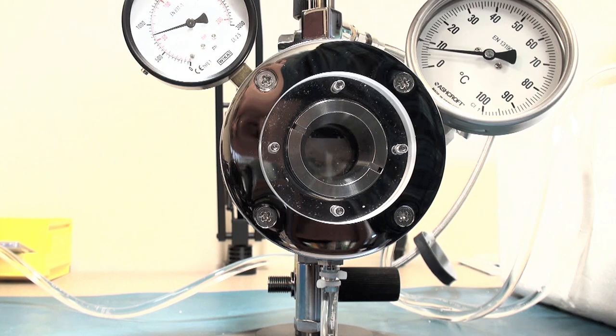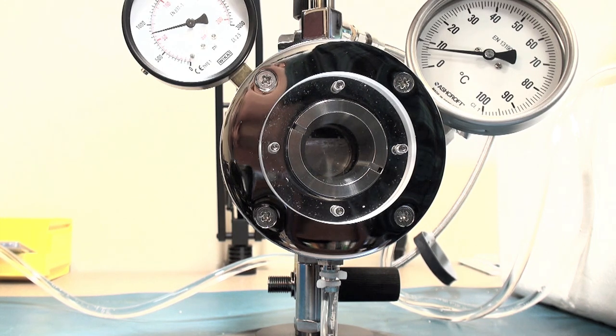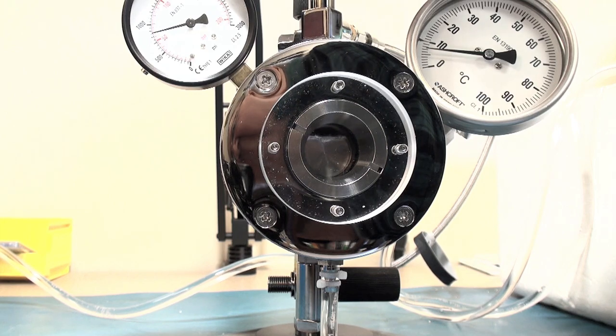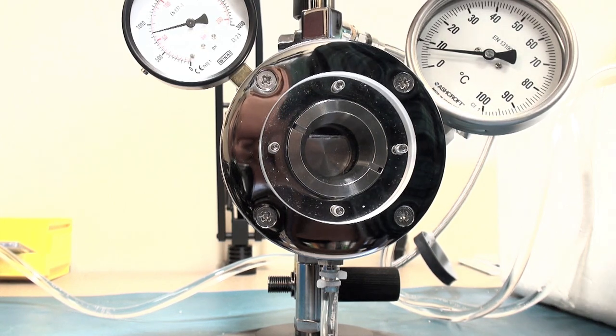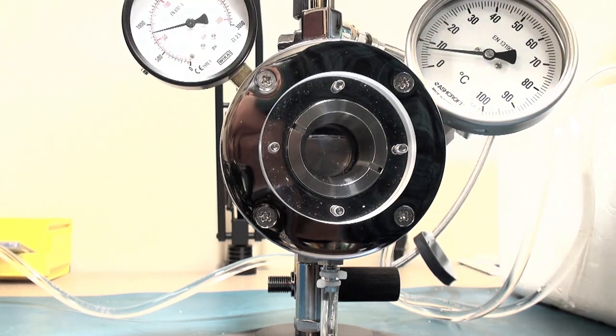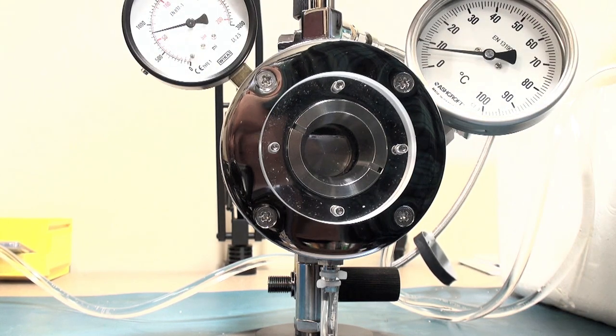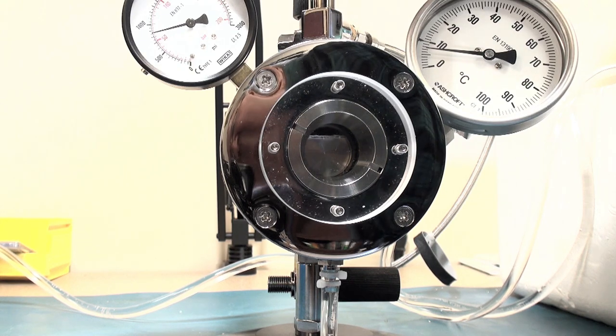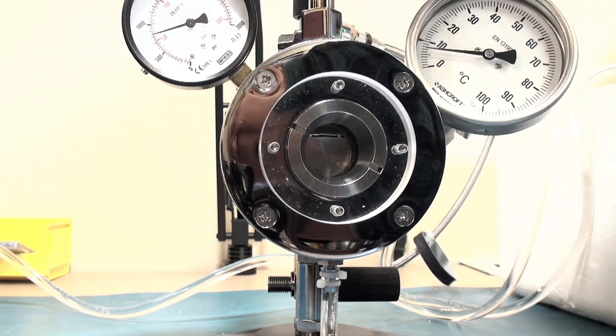And I can see liquid CO2 entering the system. You can see the fluid level rise. I am getting it up over the top of the sample boat. So you can see the manometer is reading about 70, 50, 60 bar pressure. I am closing the valve.